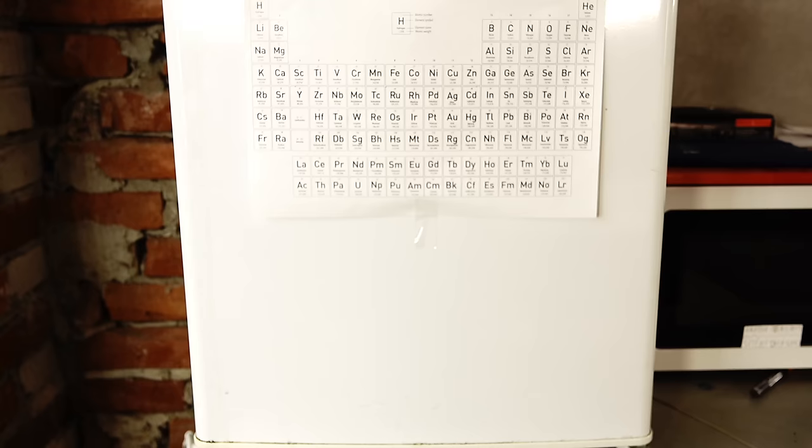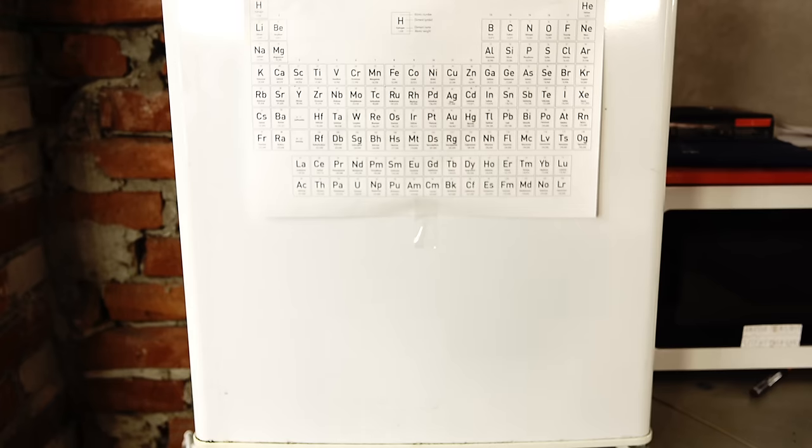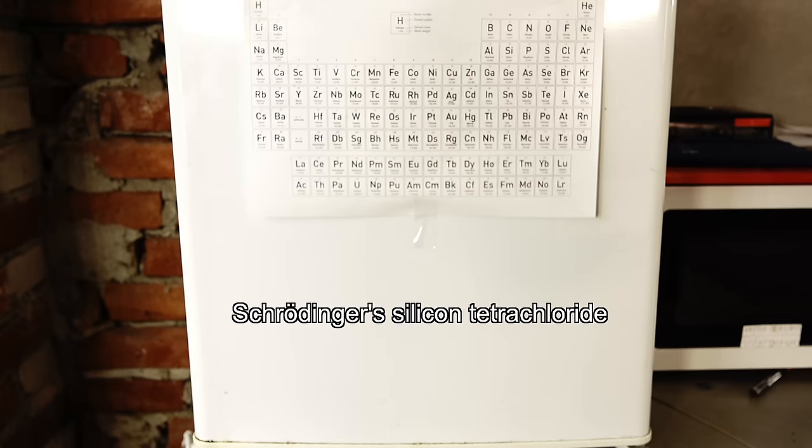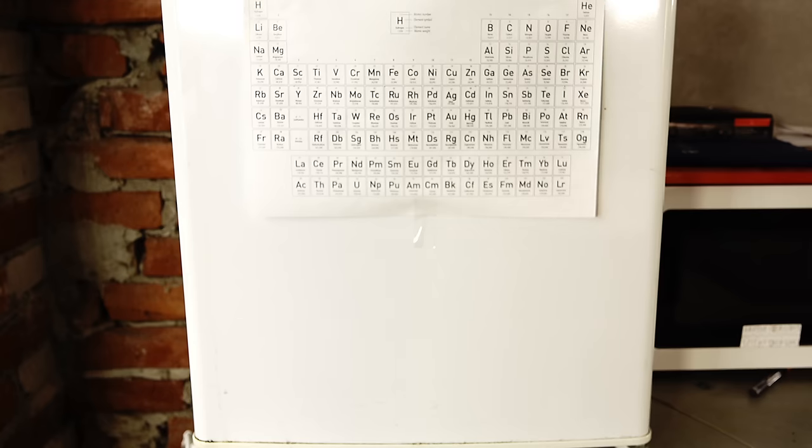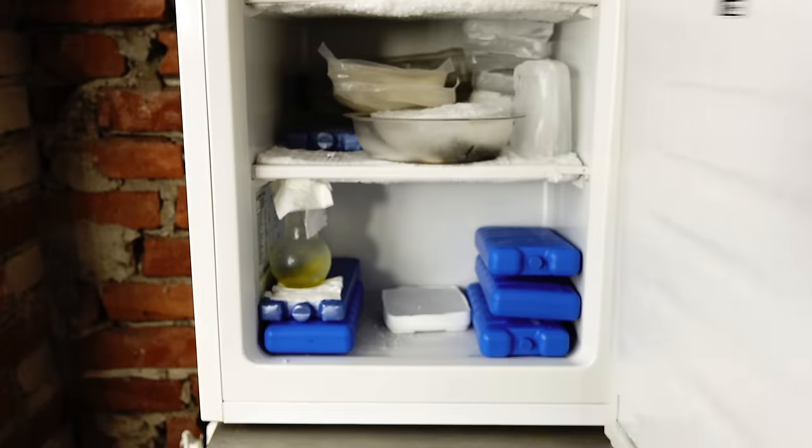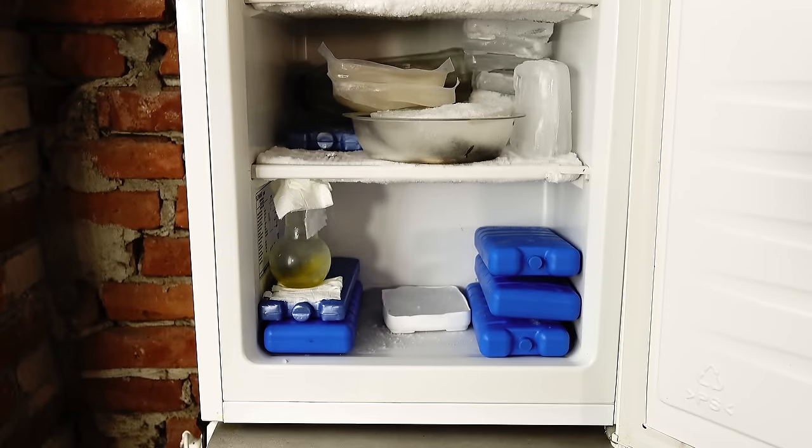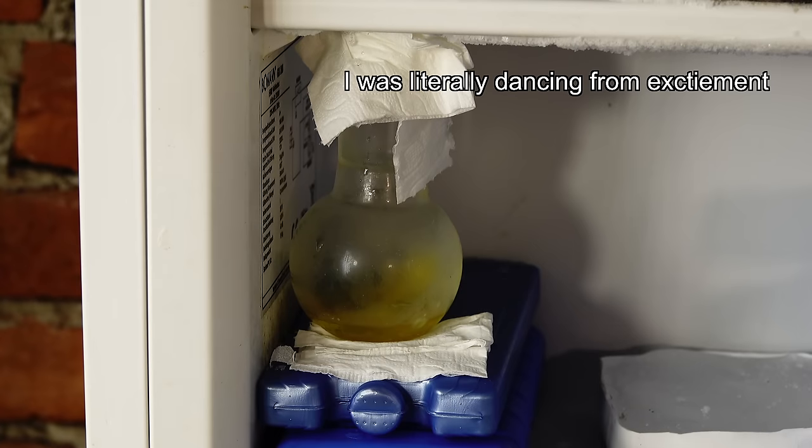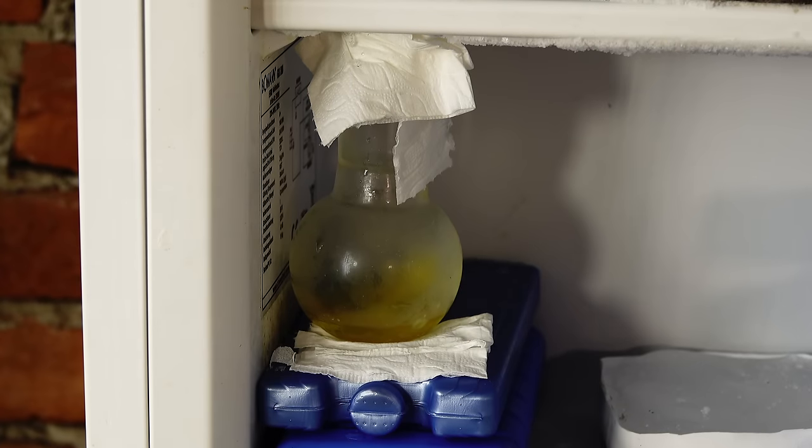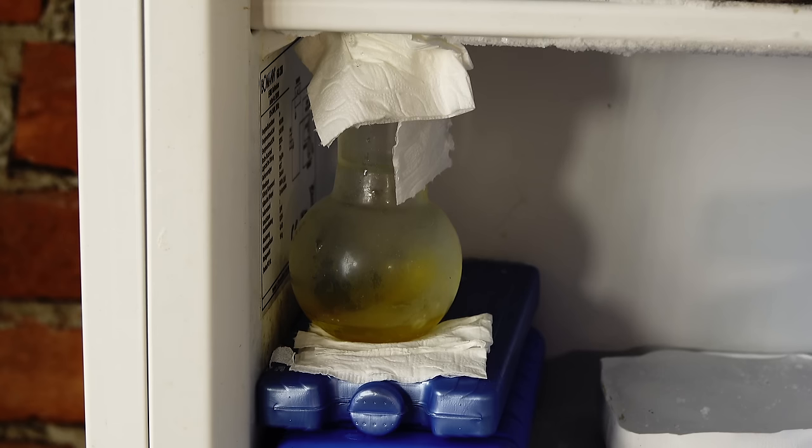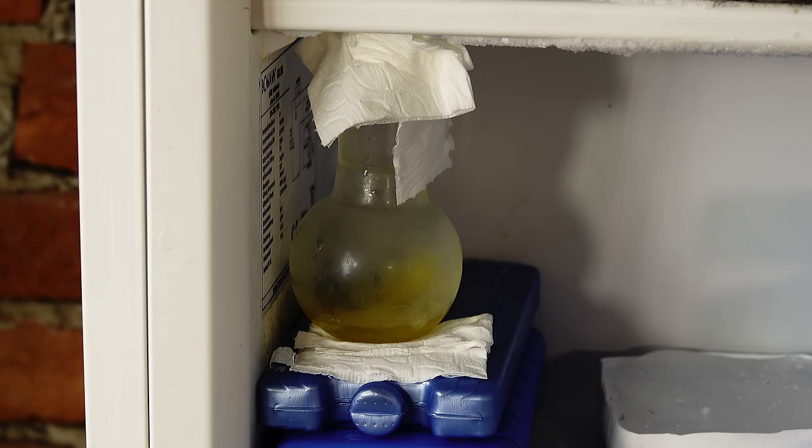When I was done it was now time to get my product out of the freezer and it was honestly pretty likely that it had all just evaporated. It felt like it was and wasn't there at the same time and I mentally prepared myself that all this work was for nothing. To my surprise my genius storage method had done its job because it looked like everything was still there. Now when I take the flask out of this carefully controlled environment all my product will evaporate in no time so I decided to prepare everything I need to store it in advance.